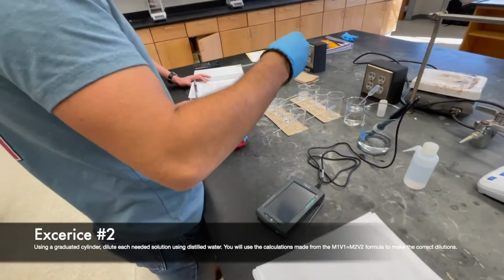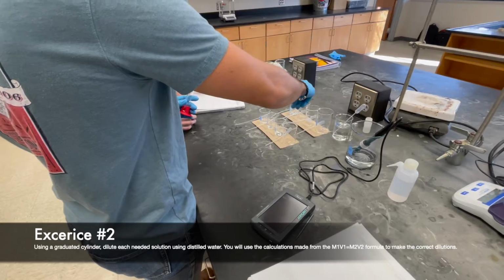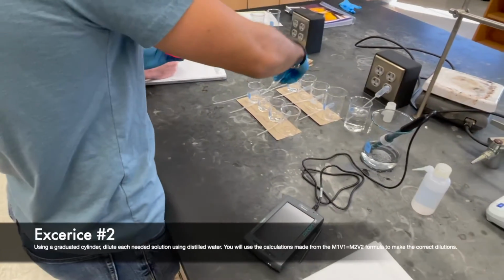Remember to use a graduated cylinder to correctly measure the needed amounts of water and stock solution to correctly give you the necessary dilutions needed for experiment 2.